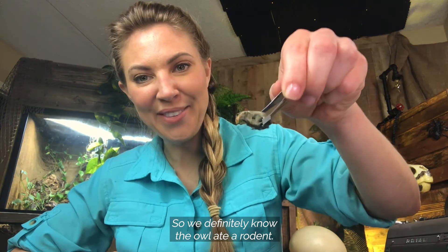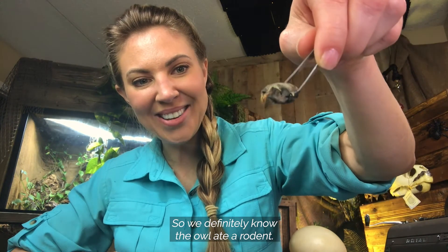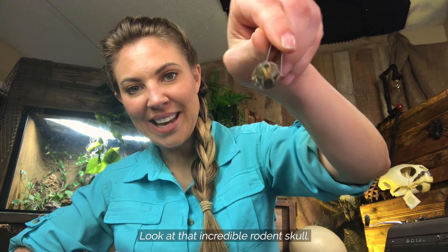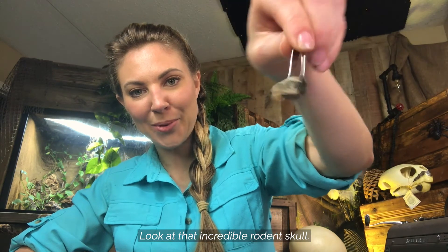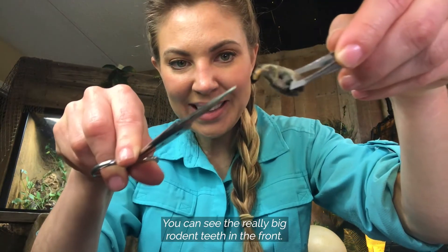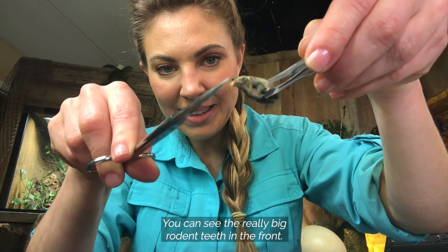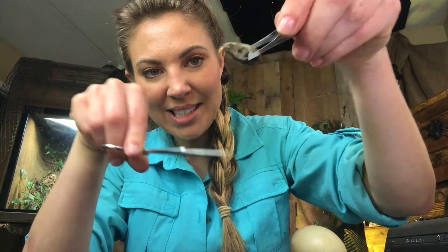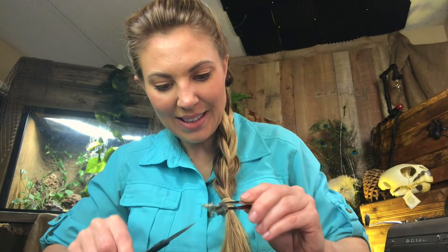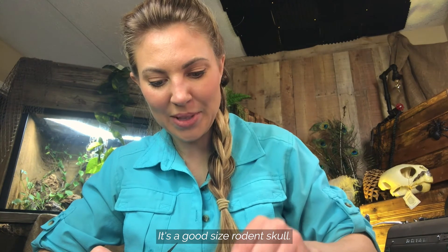We definitely know the owl ate a rodent. Look at that incredible rodent skull — you can see the really big rodent teeth in the front. It's a good-sized rodent skull.